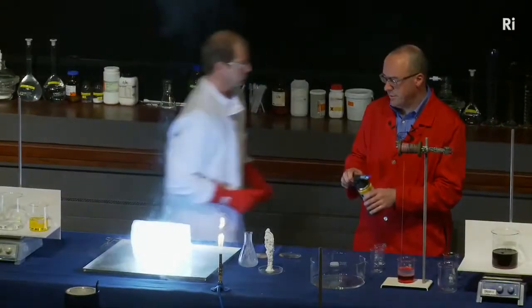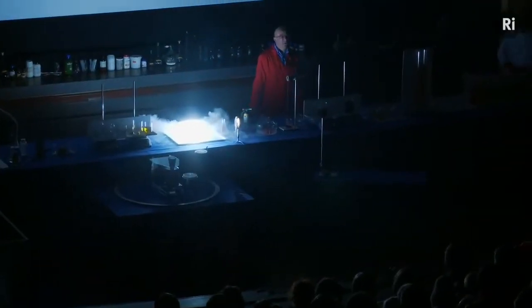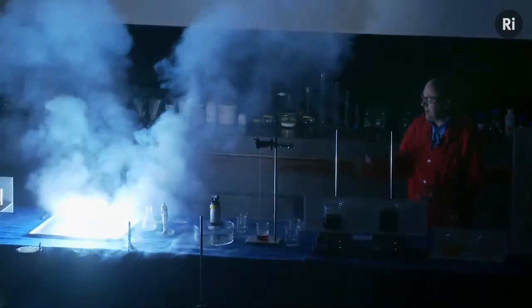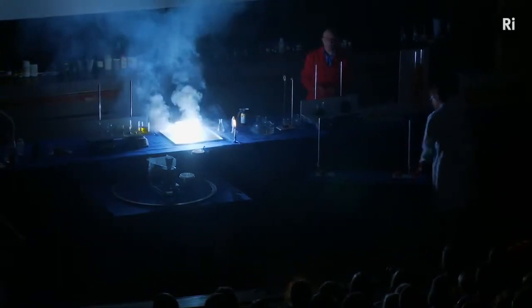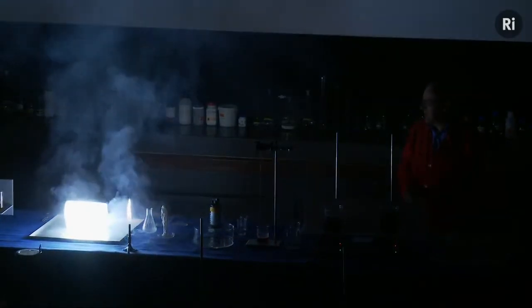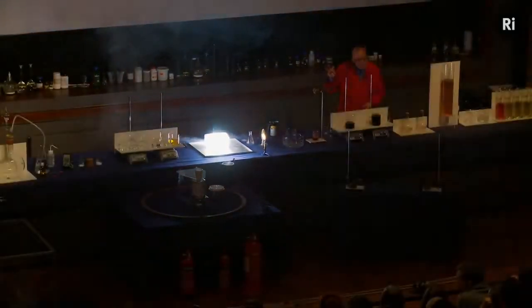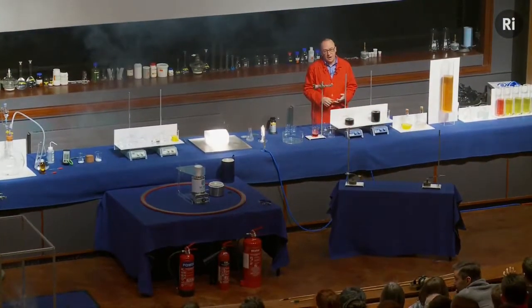And if we bring the lights down, you can see the combustion is becoming more vigorous. And this is magnesium burning in carbon dioxide. So it's not putting the fire out, it's actually supporting combustion. It's giving off this beautiful light. The white smoke you see is magnesium oxide. This is the sort of stuff that's used in indigestion tablets, that kind of thing. I wouldn't recommend that for dealing with indigestion. So the magnesium combines with the carbon dioxide to make magnesium oxide and carbon. Thank you.